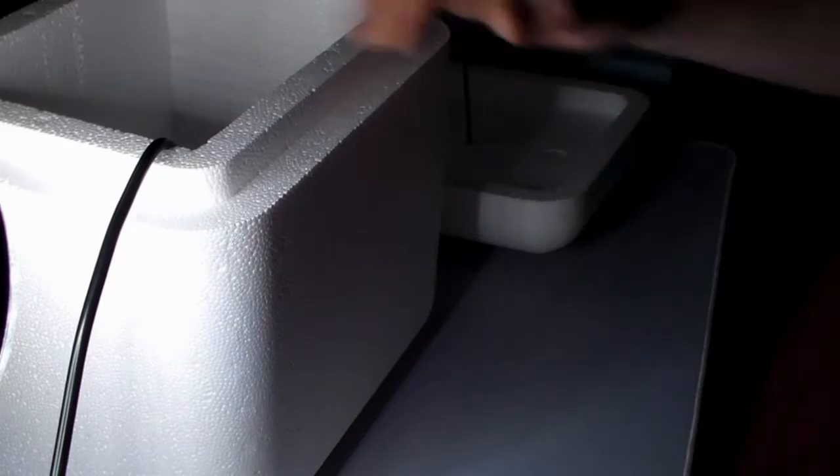All right, well, you don't need to see me. This basically is done. I'm just going to cut a little hole here. But you'll see, I guess, the next thing we'll see is as we're getting ready to perform the experiment. So come on back. The Petri dishes will be here tomorrow. I will probably do the experiment on Saturday, and that gives me the whole day to do that. So we'll do that, and then we'll see how it goes.